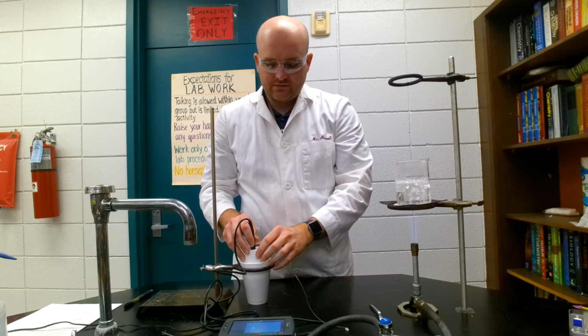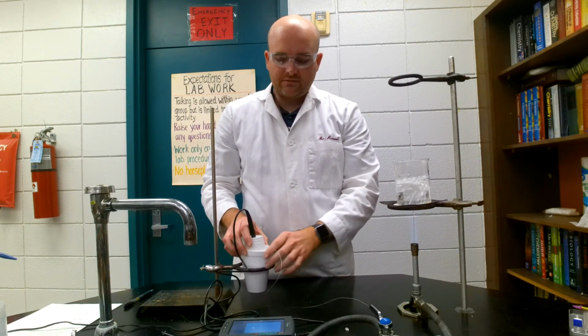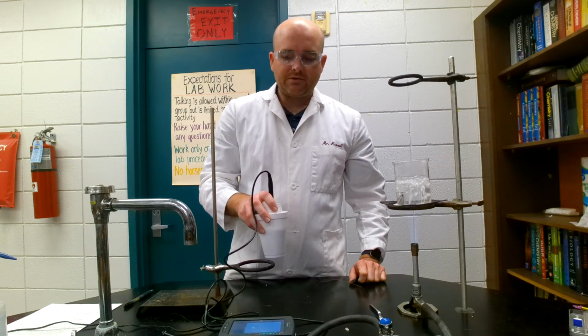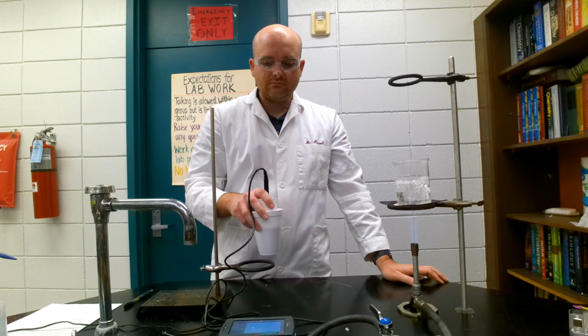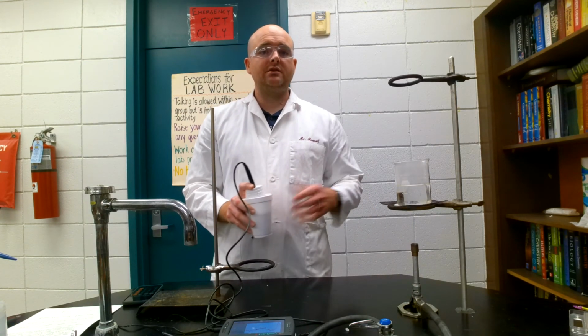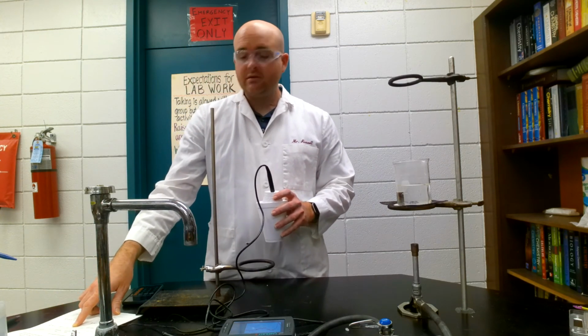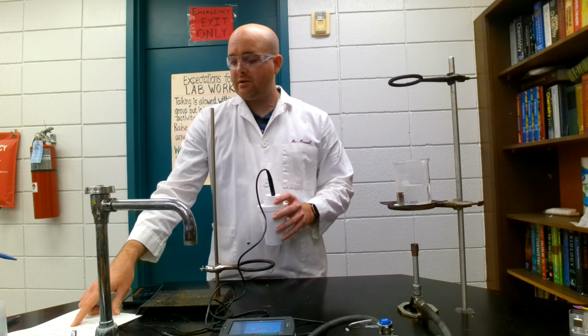Alright. And now, the heat of the lead is now transferring into the water, and the temperature of the water is going up. Okay, so now I'll just sit here and stir so I can try to evenly distribute the heat. Okay, so I tracked the heat change, and surprisingly, the heat of the water only went up by 1 degree Celsius. So the final temperature of the water is going to be 24.1 degrees Celsius.